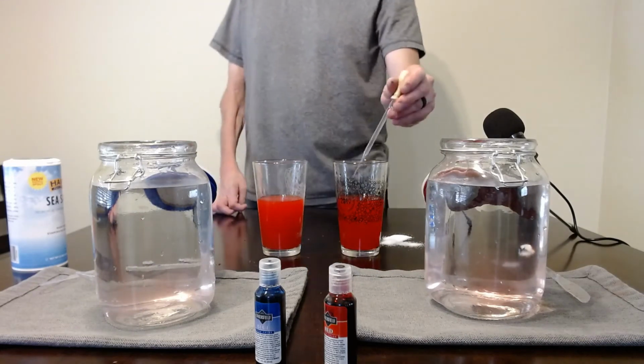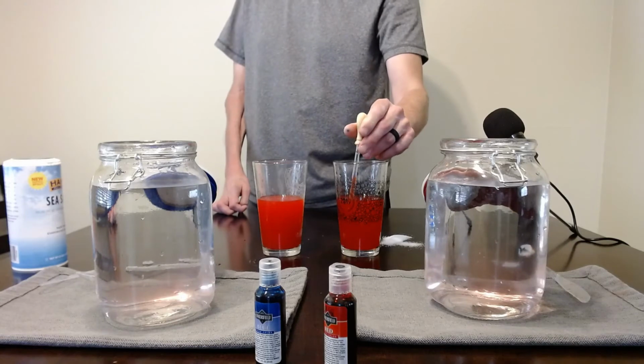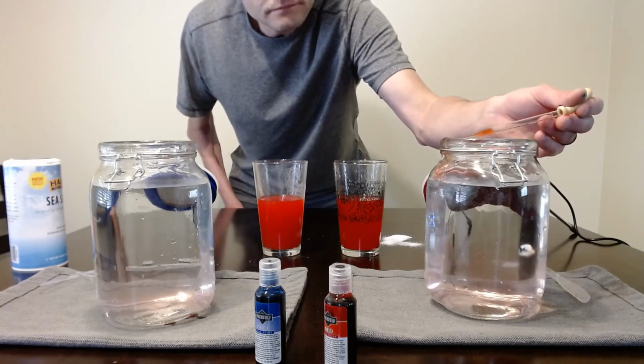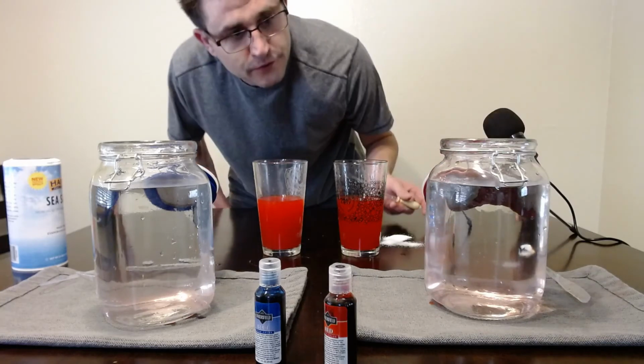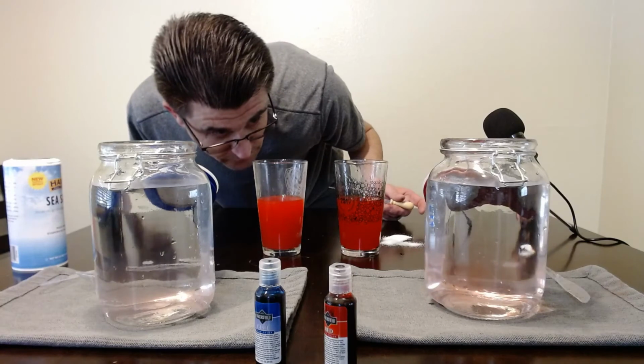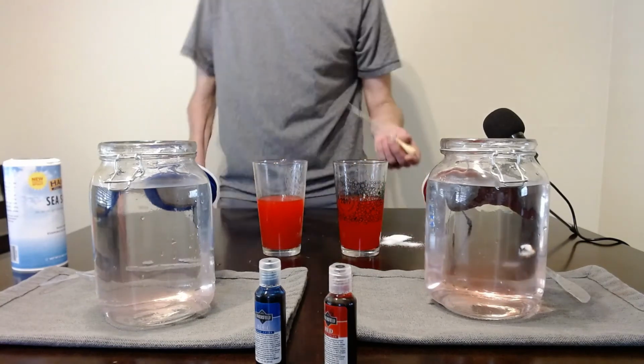Okay, if you can't see it clearly, I'll tell you how long it takes to get to the bottom. So here's solution A. 1, 2, 3, 4, 5, about 5 seconds.